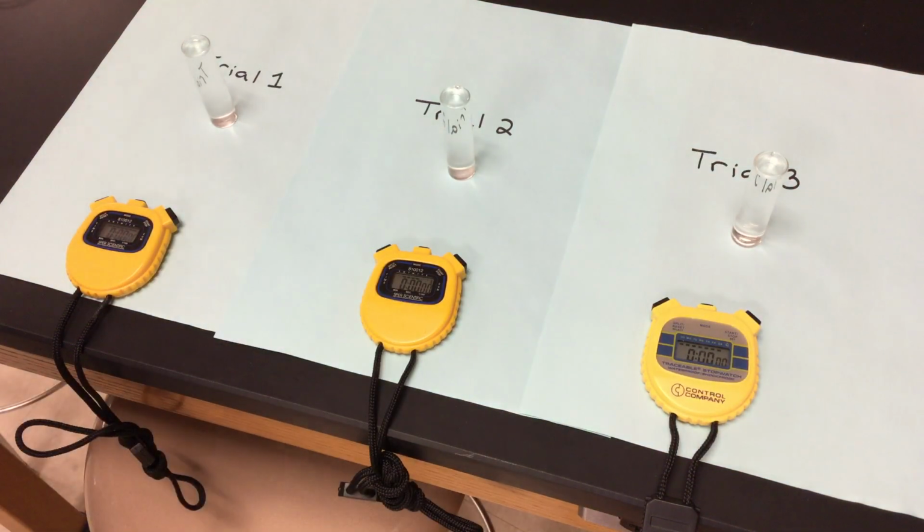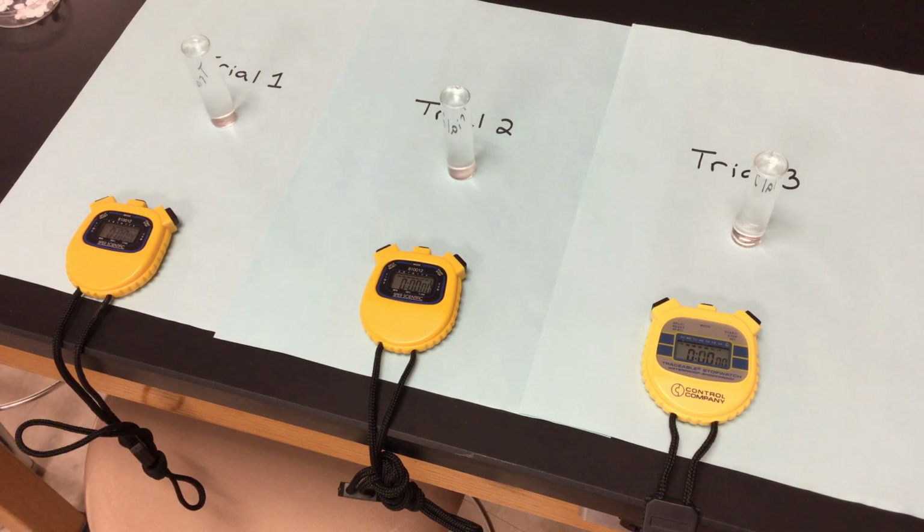So what could affect my times? Well, maybe I have 2 pieces of filter paper stuck together. Maybe I've got a little bit more yeast on one than the other. Maybe there's a little bit more solution in one than the other. So there's a lot of factors that could take place within this.